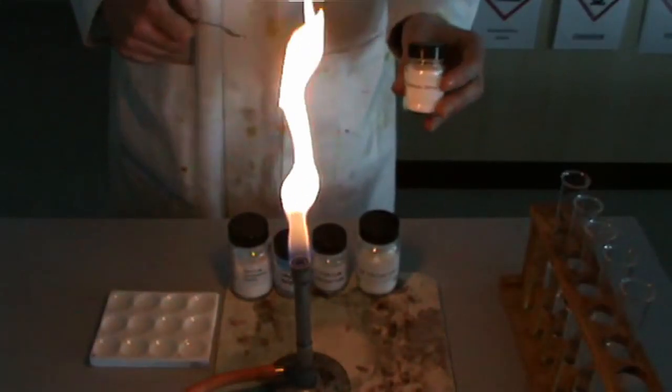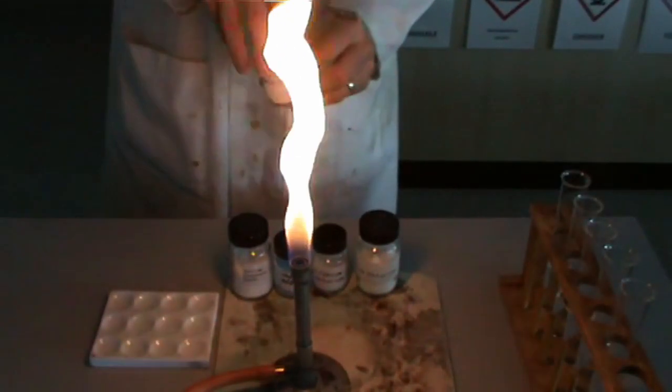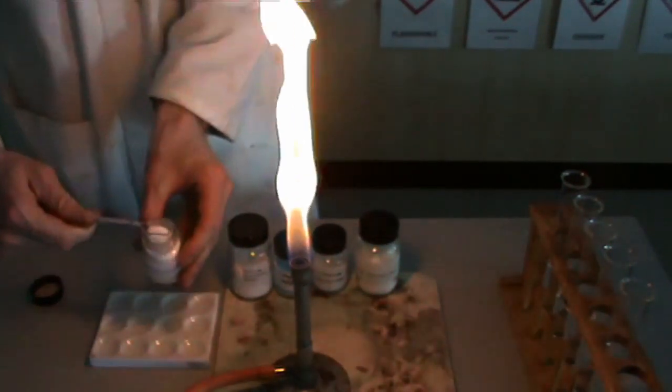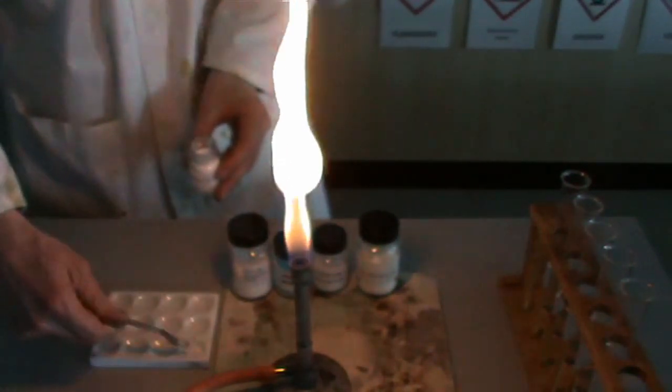Now we're going to do the flame tests, but starting with the solids. In order to make the flame test work as effectively as possible, we need to dissolve a small quantity of the solid in water.